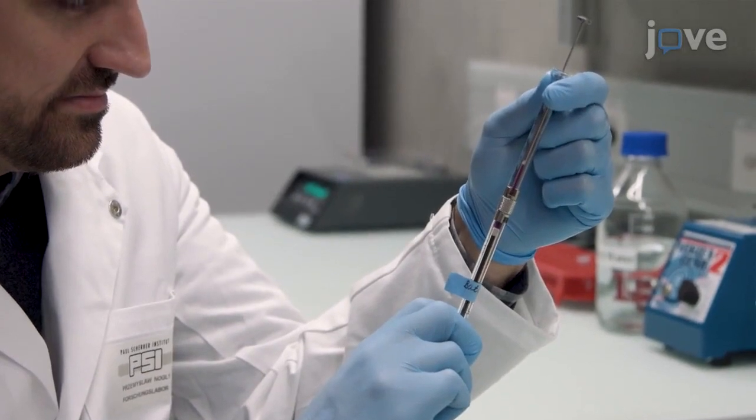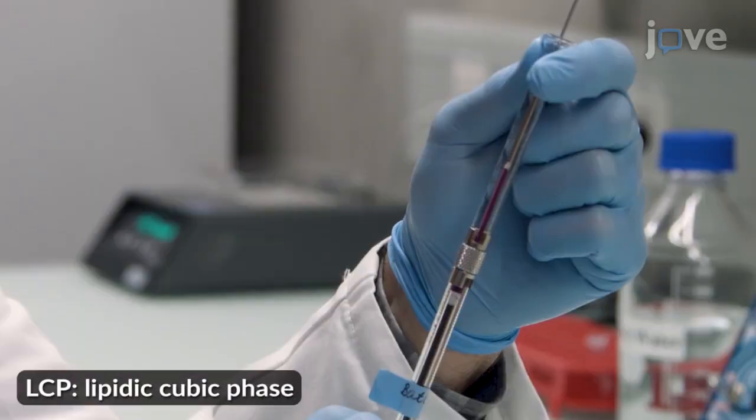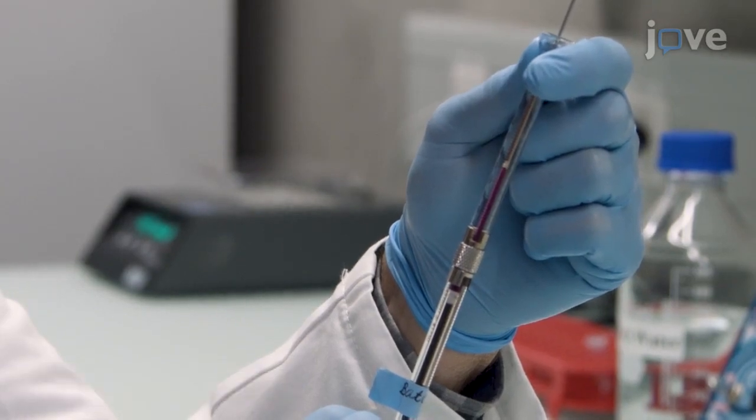First, load 50 µL of crystal-laden mono-olein-based LCP in a 100 µL syringe about 30 minutes before the injection.